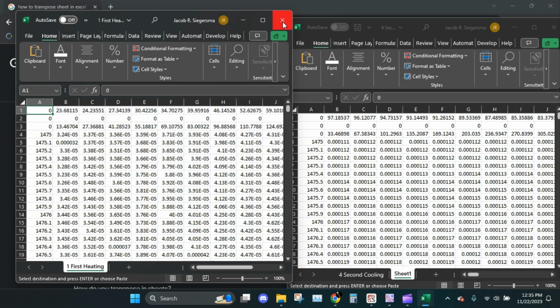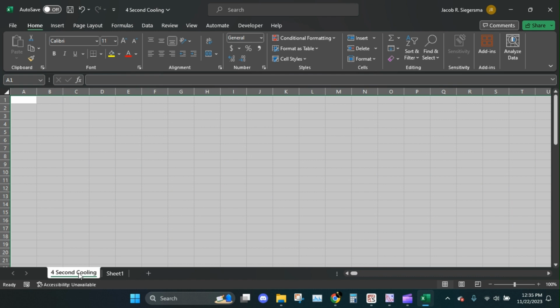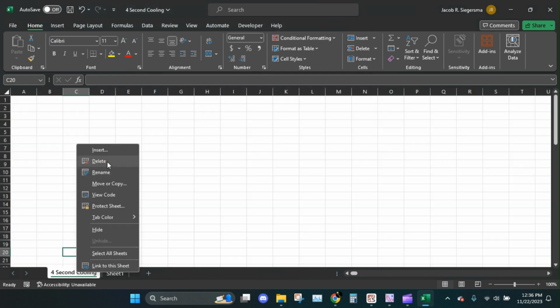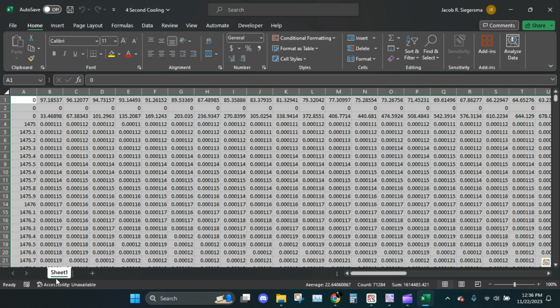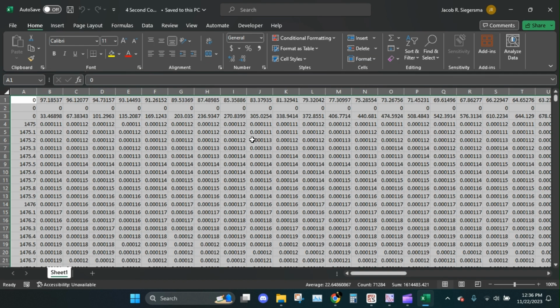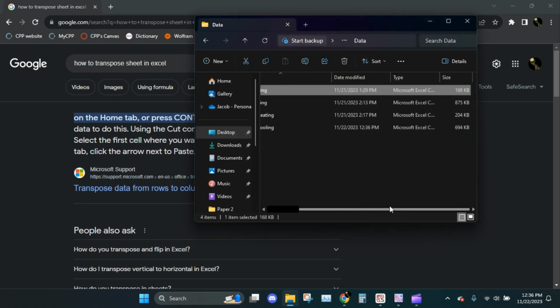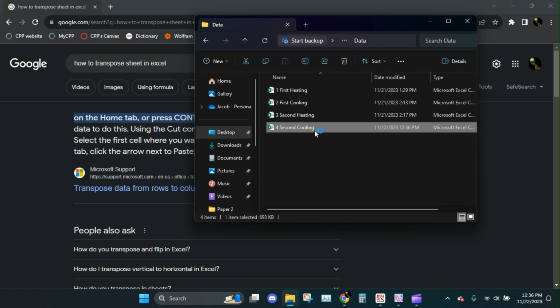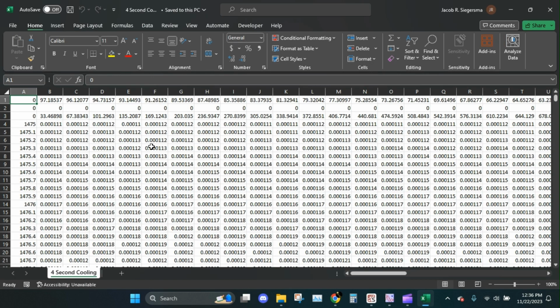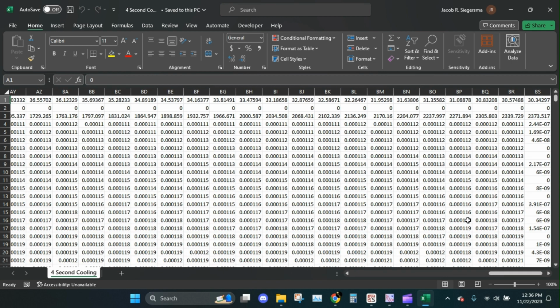Alright, so let's close that. This one, we're going to have to delete that whole sheet. Then we're going to save. I'm just going to open it up again just to make sure that it's fine. So second cooling. Boom, there it is. And man, you have a lot of entries here.